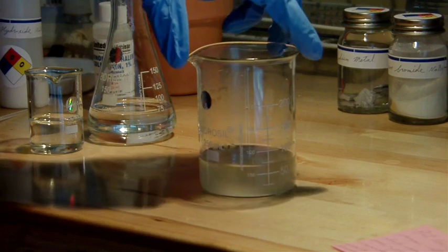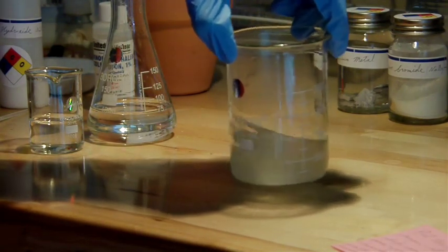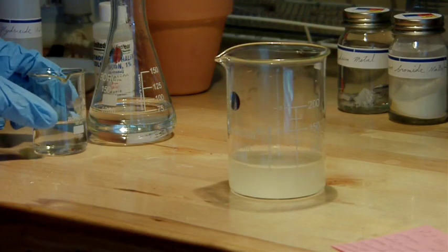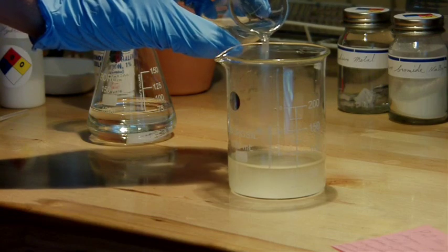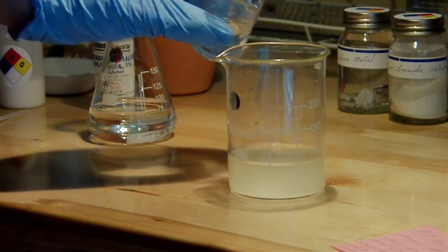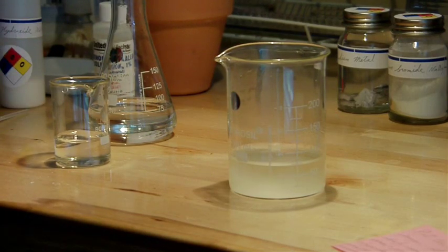So I'm going to be adding things fairly slowly. Now there's a good plume of steam. And we'll hold off for a minute and let that cool down.